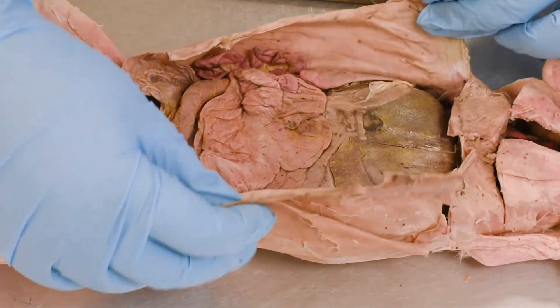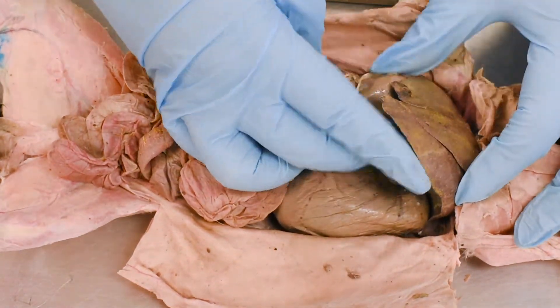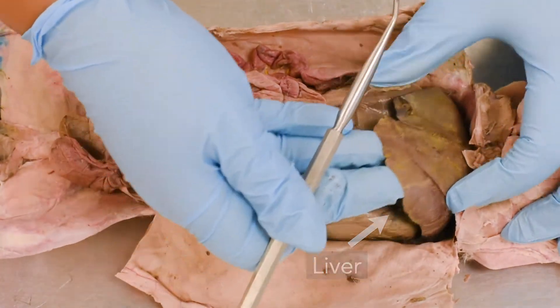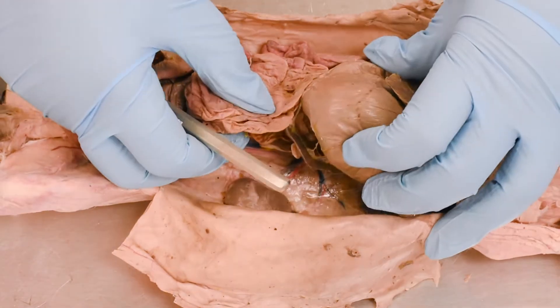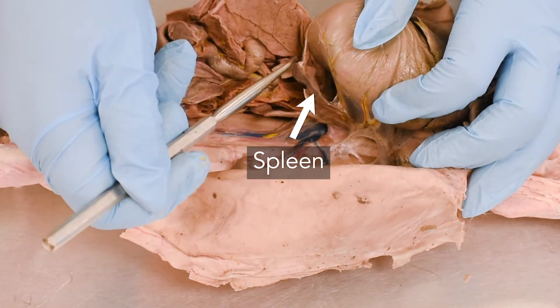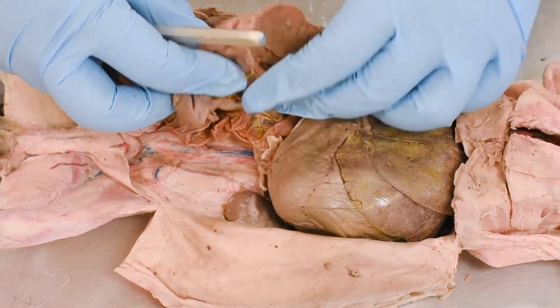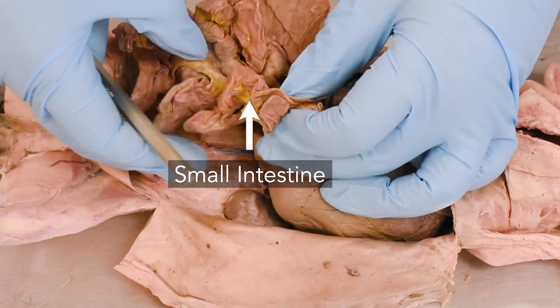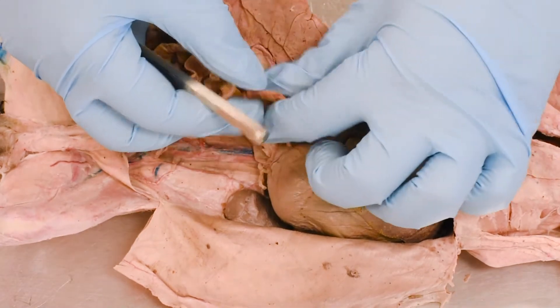As soon as we open the abdominal cavity, the huge area is taken by two organs. Here is the liver. Underneath the liver, look at the stomach — how big it is. Behind the stomach, that means posterior to the stomach, this is the spleen. Following the organs of the digestive system, here is the small intestine. Within the small intestine, you can see beautifully the mesentery.